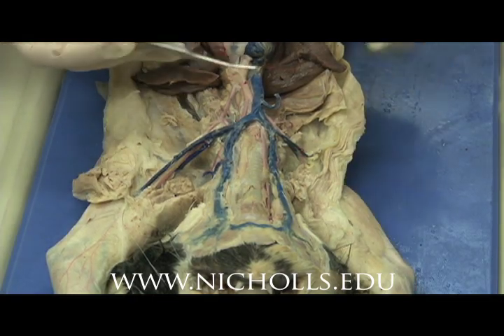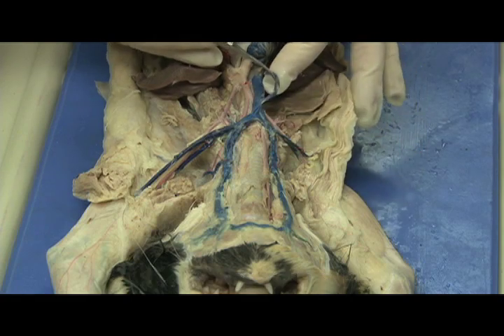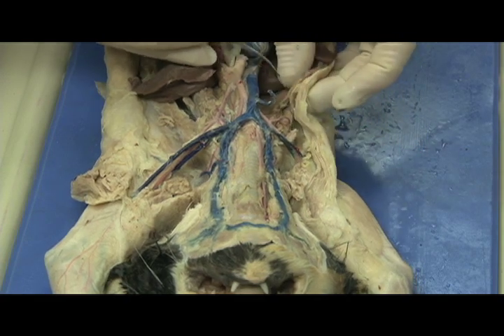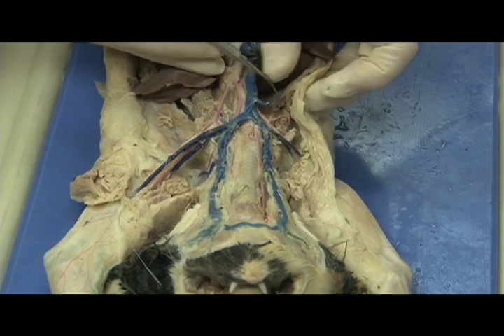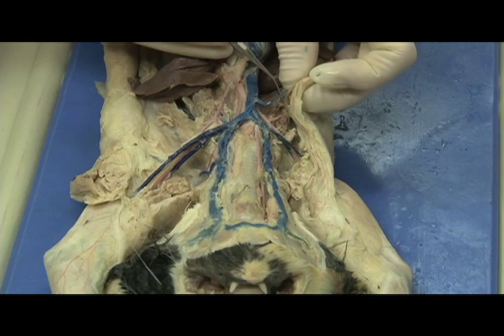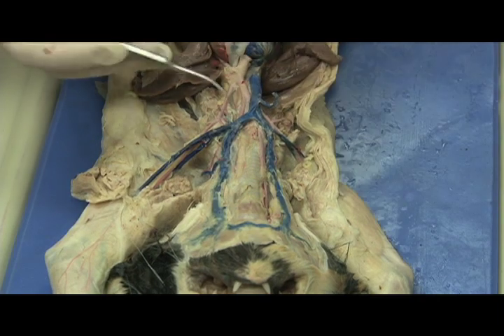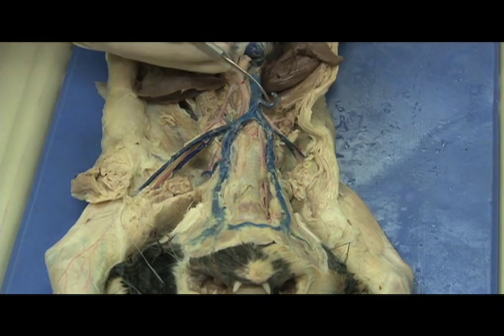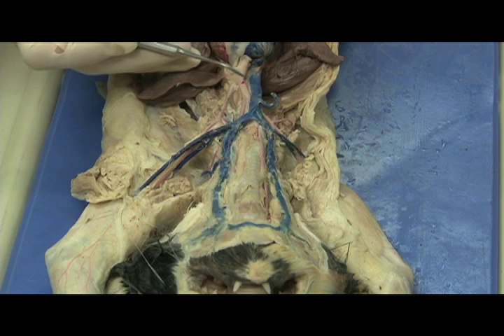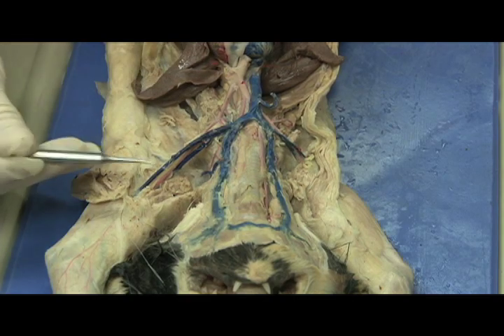This is the superior vena cava bringing blood into the right atria of the heart. This is a trunk known as the internal mammary vein draining the anterior chest wall. The superior vena cava will bifurcate into the brachiocephalic vein.